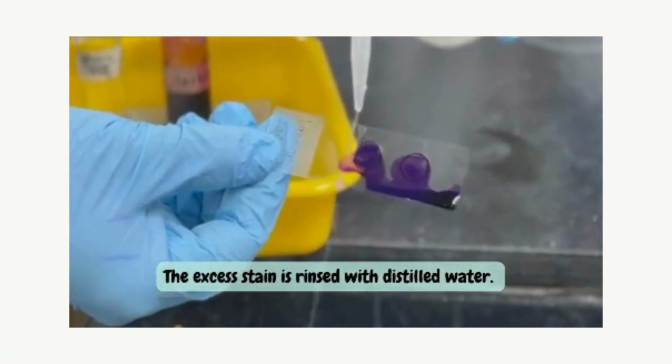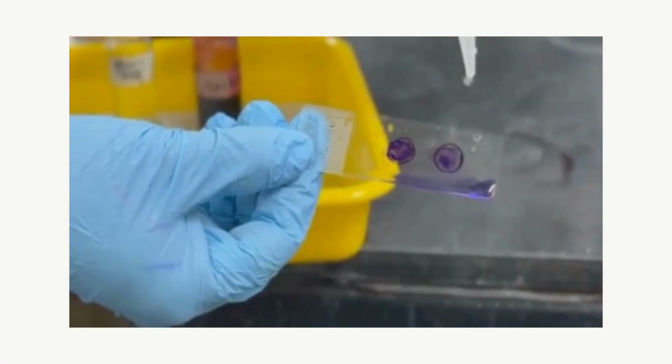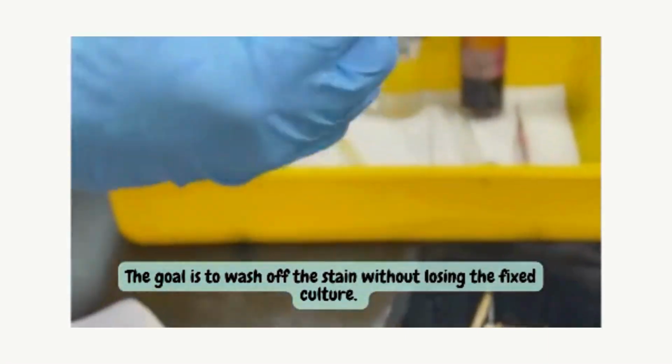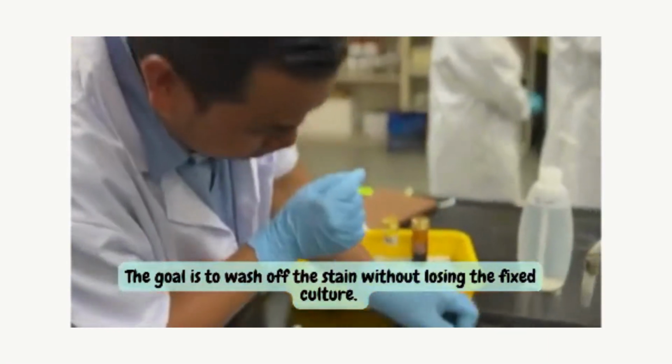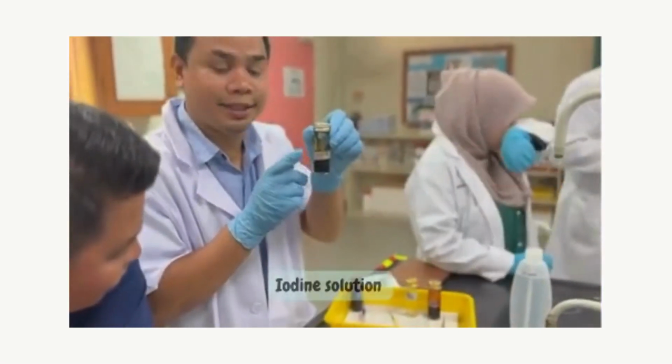The excess stain is rinsed with distilled water. The goal is to wash off the stain without losing the fixed culture.